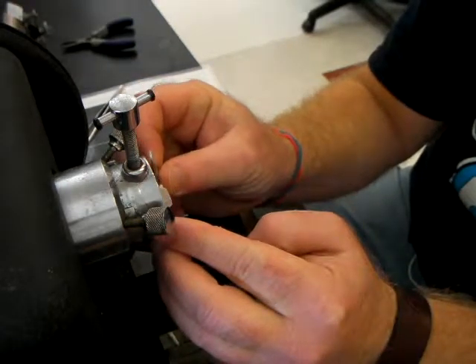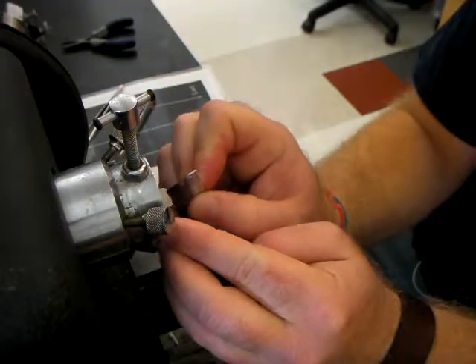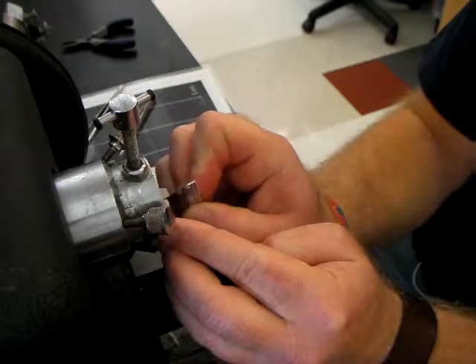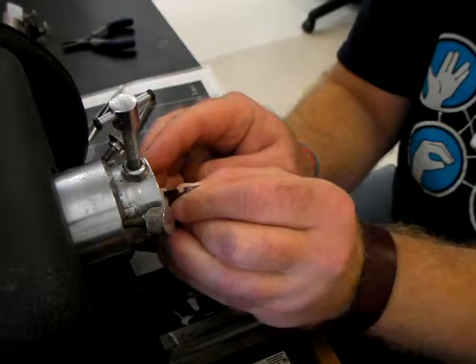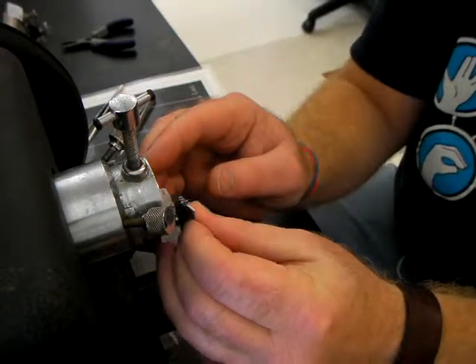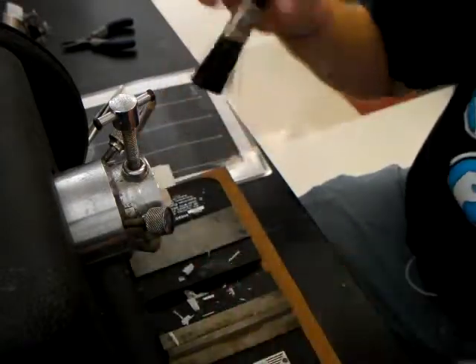Don't leave yourself excess paraffin making extra wide ribbons — that is not a benefit in any way. Trimming off excess paraffin: the two sides should be more or less parallel to one another, but it is certainly less vital than the top and bottom of the block being absolutely parallel. Take your time, be careful, and make sure not to cut into the specimen.